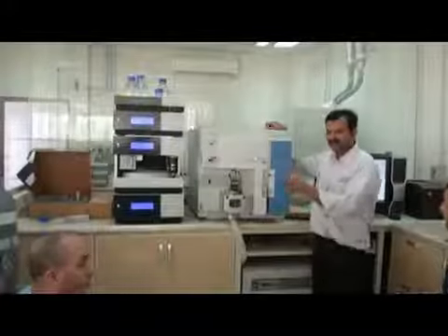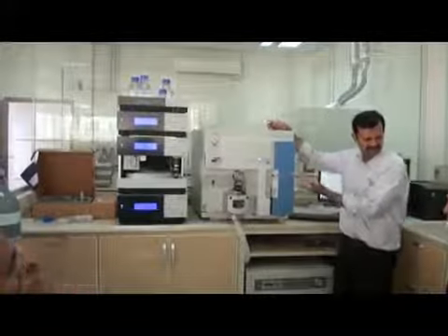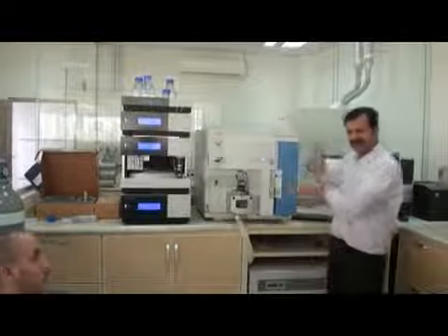The high voltage is on the corona needle, not on the probe itself, in another type of technique. Okay. Any other question? Any other thing? We have to do this. So when we will do this, then I will explain it. Okay, no problem. When we will do this, then we will explain.